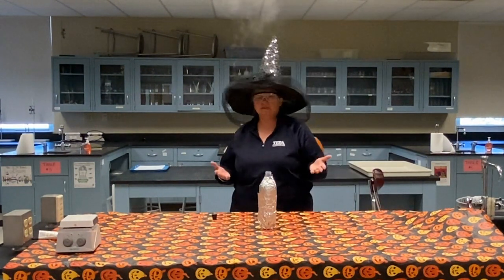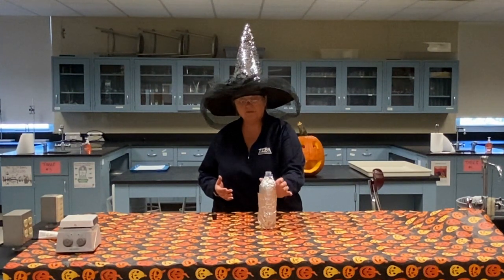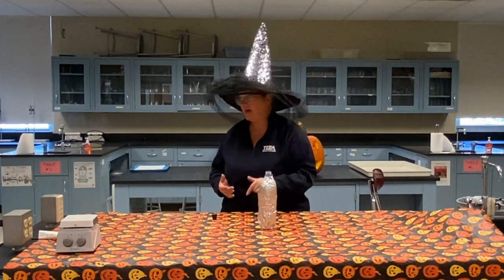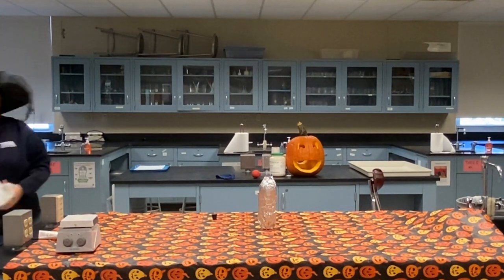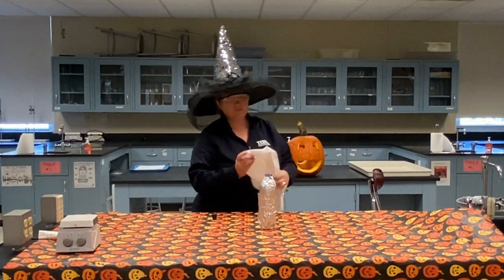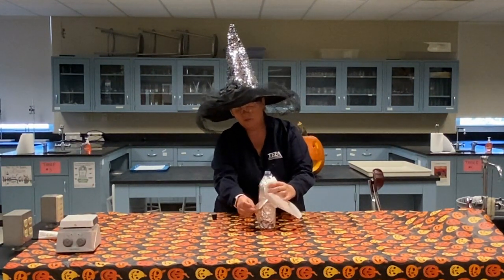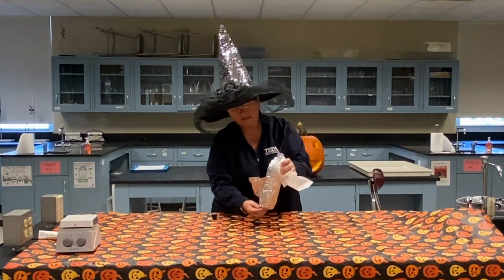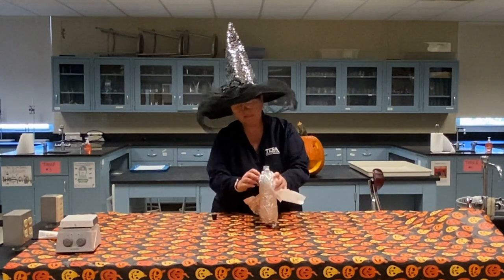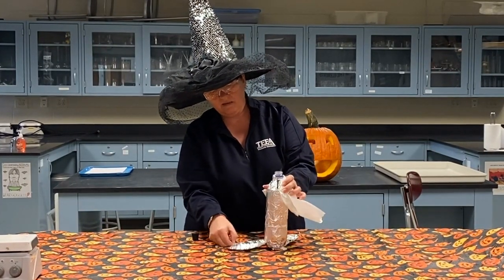Okay, so what happened in this particular chemical reaction? Well, little did you know, and I have to be real careful when I do this, the bottle is very hot. So excuse me for a second while I grab a paper towel so I can show you what was inside. By putting just regular old household tin foil around this bottle, you weren't able to see what was going on inside of here. And this bottle, like I said, is very hot at this point to the touch, to the point where it's tough for me to even get this off without burning my fingers.